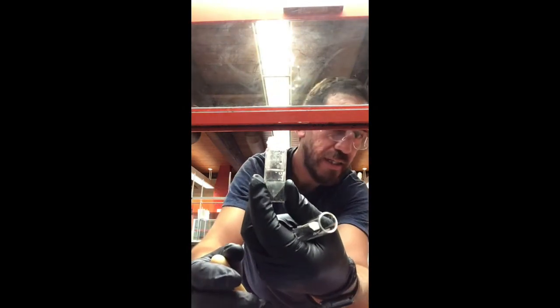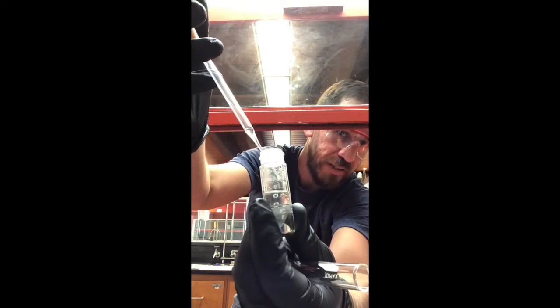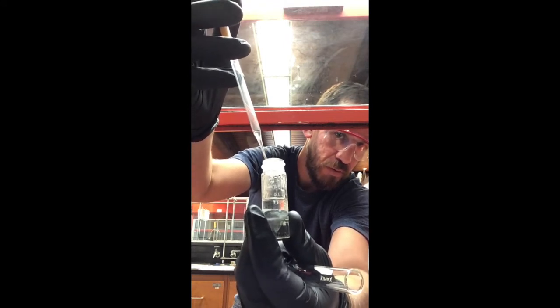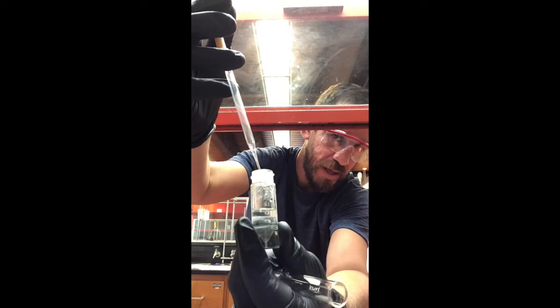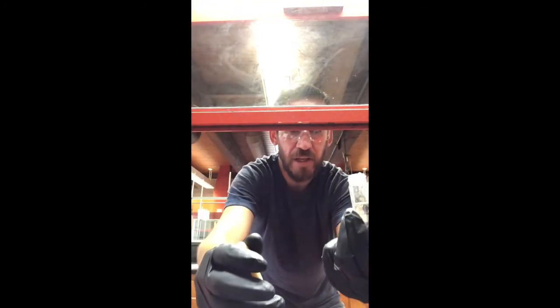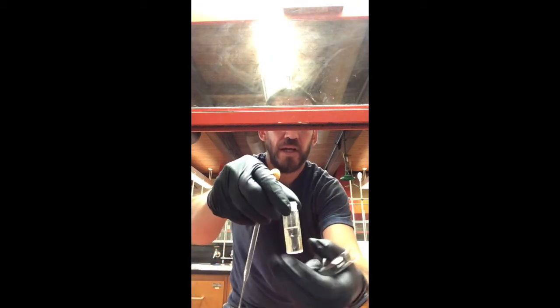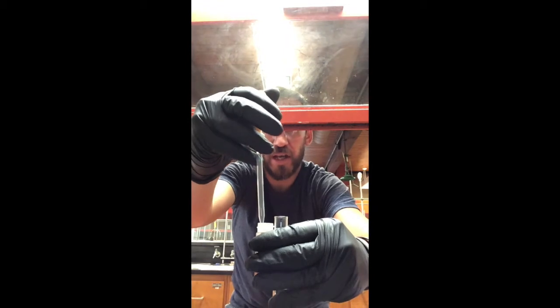With the clear conical vial we should be able to see where the drop goes. Keep an eye on the drop of methylene chloride — you can occasionally see it drop to the bottom, confirming that methylene chloride is the bottom layer. So we want to transfer only that bottom layer to a clean dry test tube.